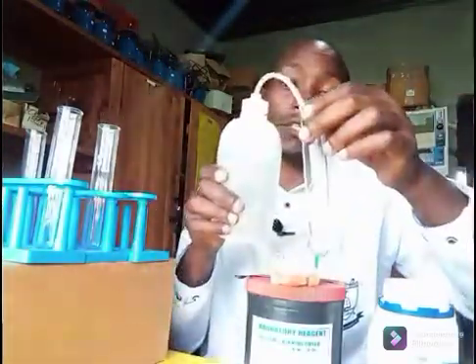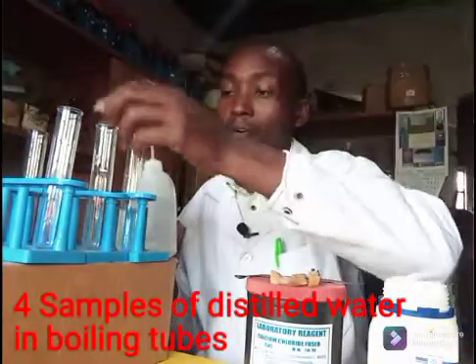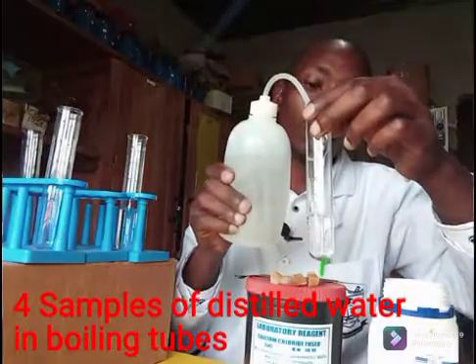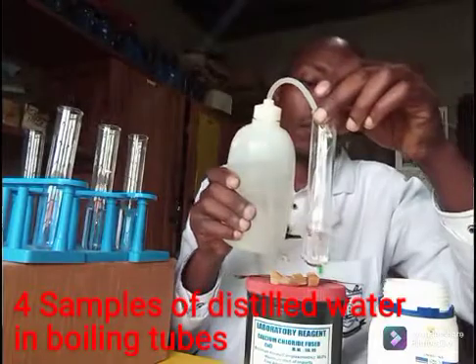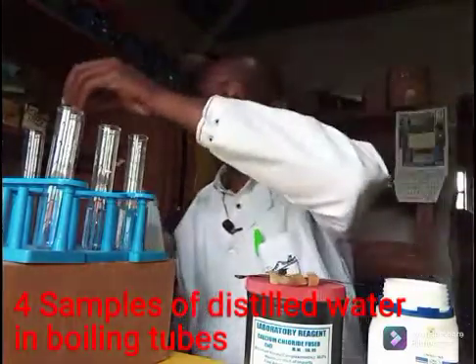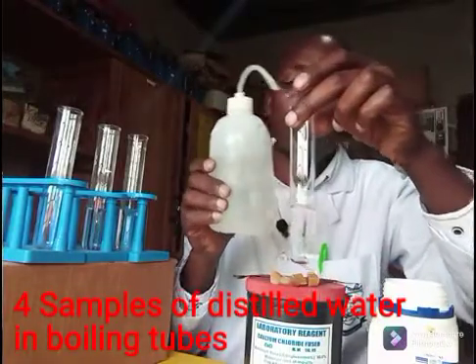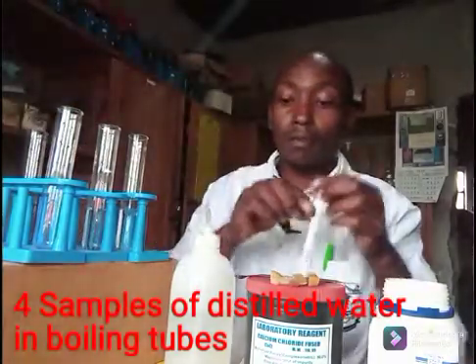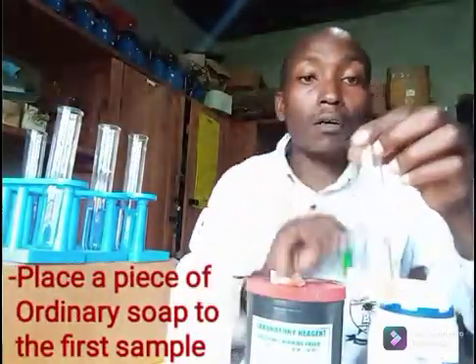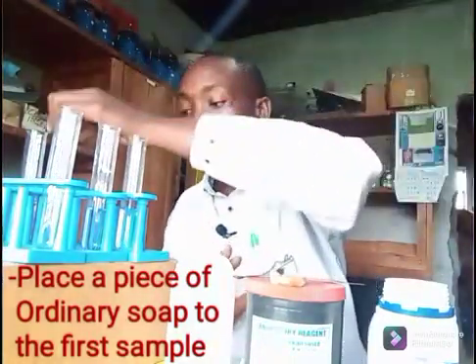I'm going to start by having a sample of distilled water in each of the boiling tubes. I'll have four samples of distilled water. In the first sample, I will just place the bar soap without adding anything.